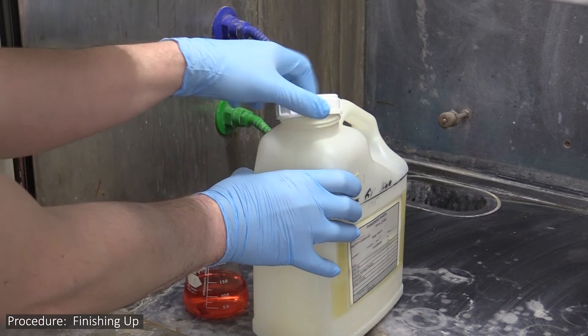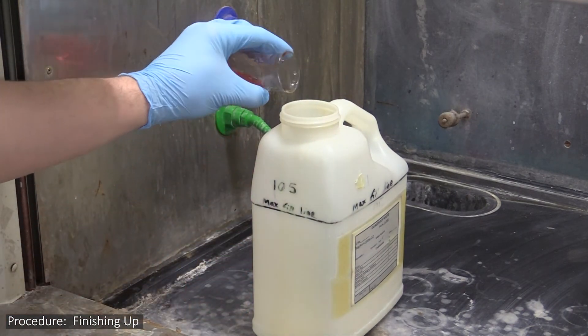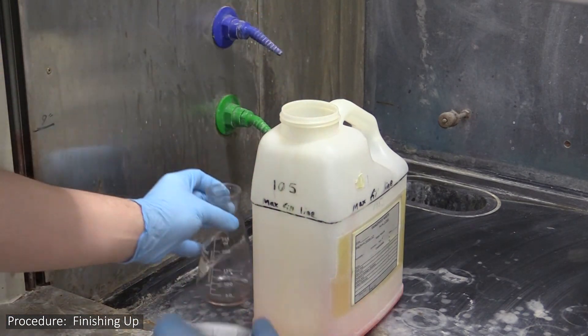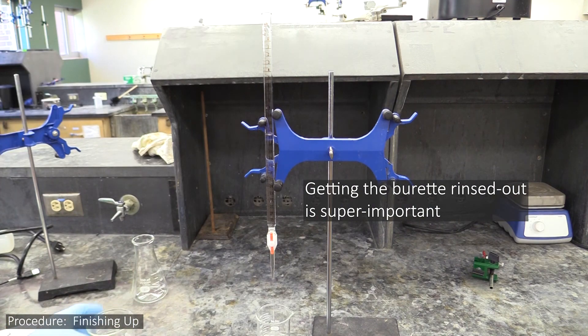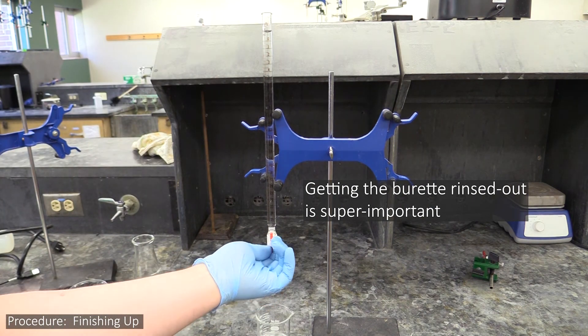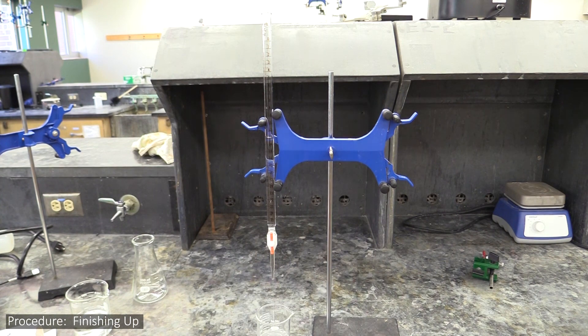And that's pretty much it for your data collection. When you're done, make sure to dispose of all solutions in the lab room's waste container. Also make sure you've drained all the sodium hydroxide solution out of your burette and thoroughly rinsed it with DI water. When you're done rinsing it, leave it with its valve open.